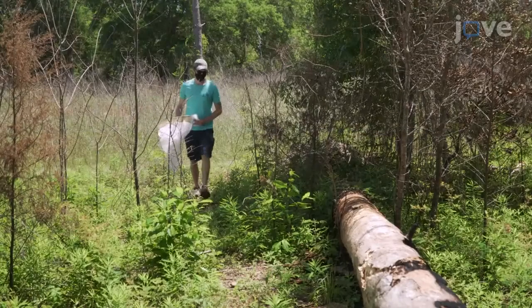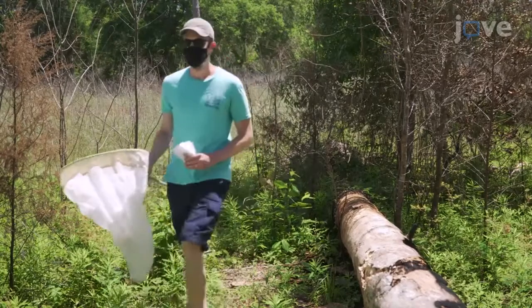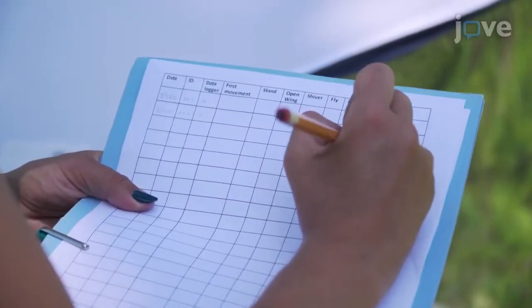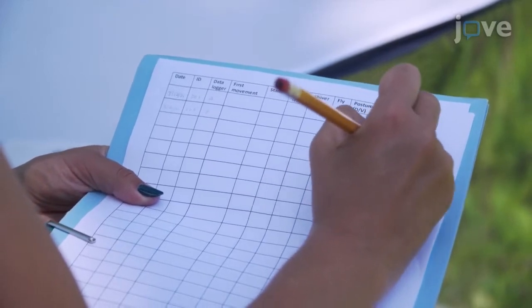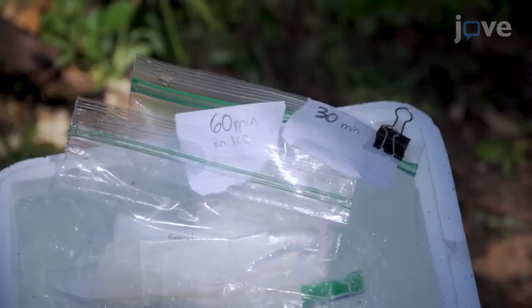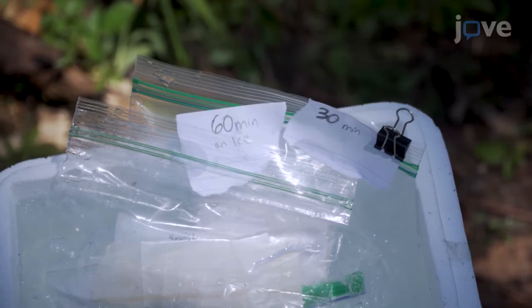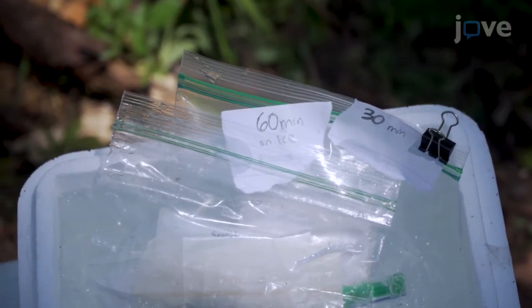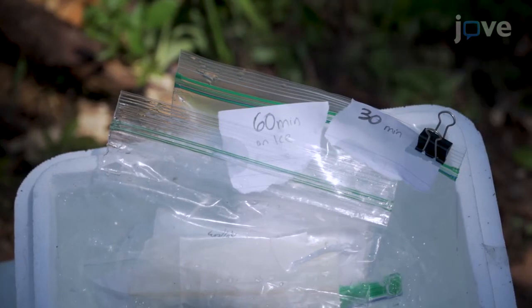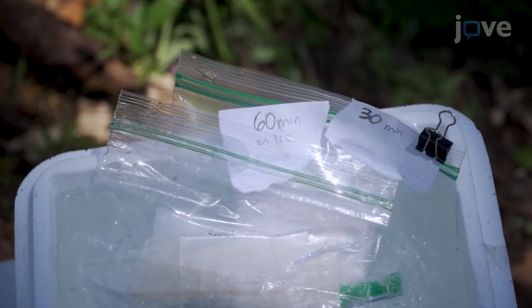Begin with identifying the species of interest, keeping in mind that each group will differ in the time it takes to induce a chill coma. Based on the organism and use of data, choose different cutoff points for the experiment if the focal individual does not fly. Conduct a pretrial on a small sample to determine the key parameters like time required on ice to induce a chill coma. Choose a cutoff time based on the ecology of the species, keeping in mind that after many minutes of being incapable of flight, some insects are taken by predators.